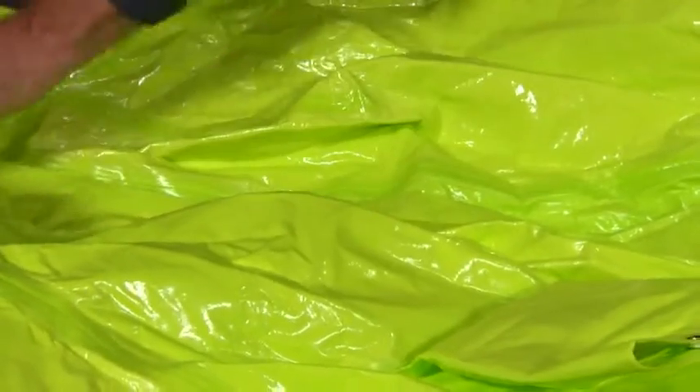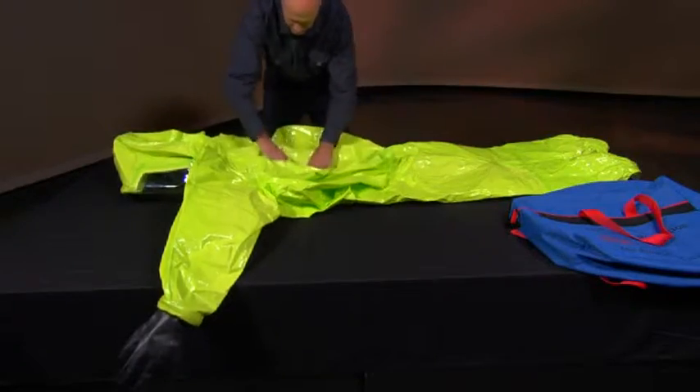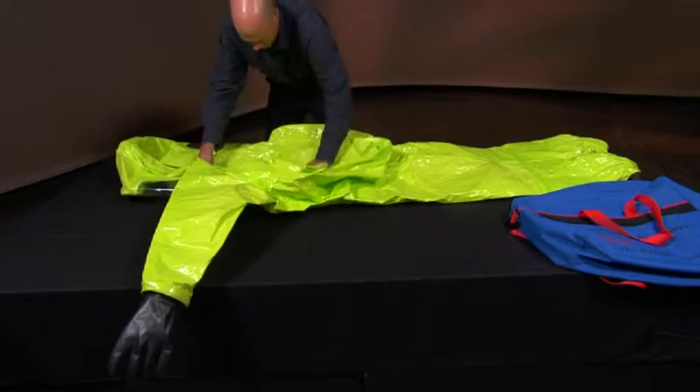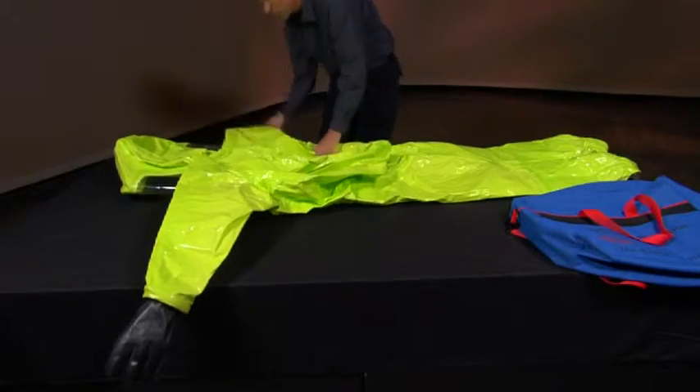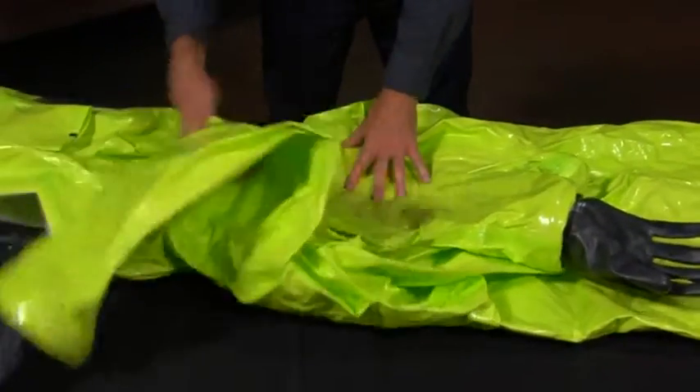However, the open zipper must be covered by the garment's storm flap, using the hook and loop fasteners, so that the zipper teeth do not damage the suit's materials when folded. The sleeves are to be brought across the back, forming a V-shape.